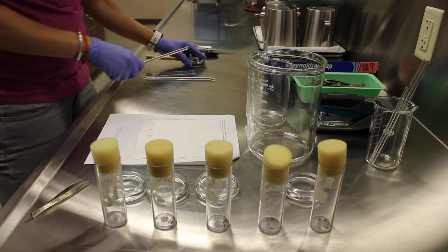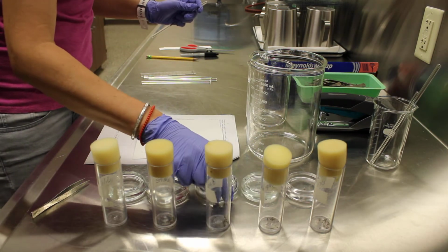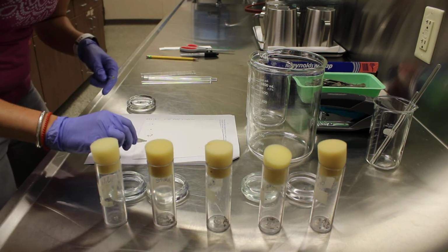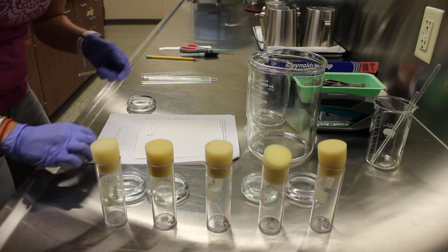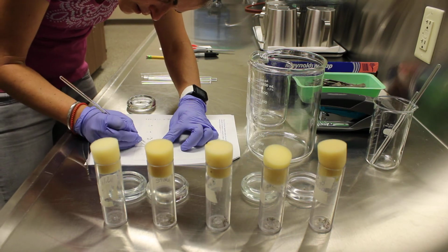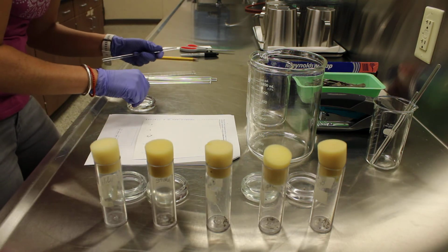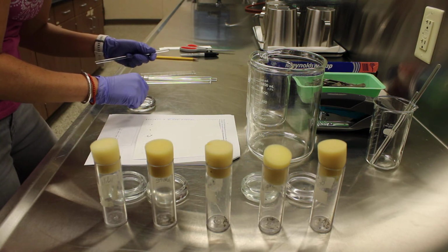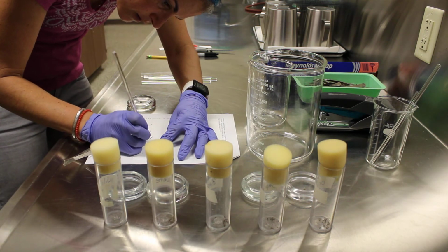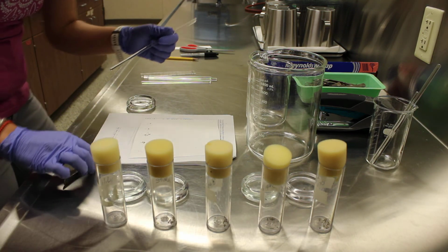Okay, grab a new clean rod. Actually, we'll put these guys here. Grab the rosy, and we'll do 4 of these guys. Kind of hard to smash that guy by the head.